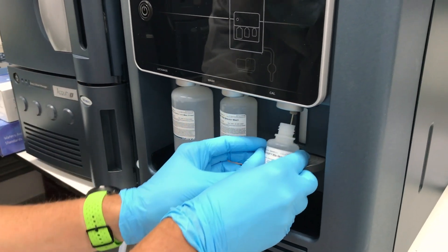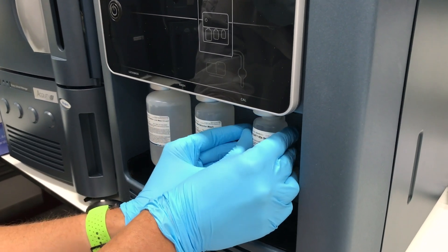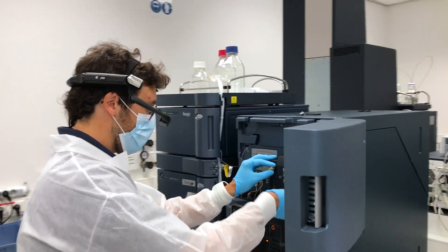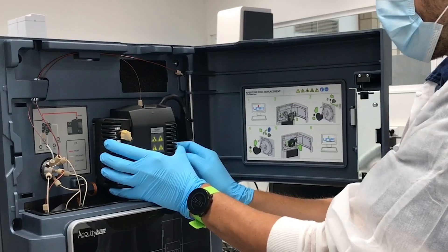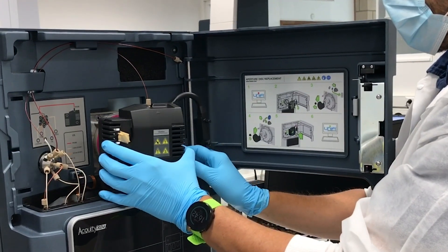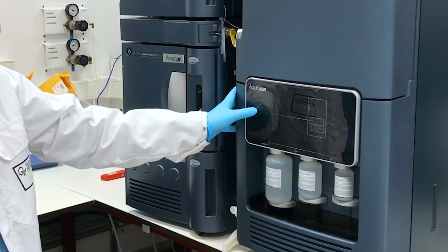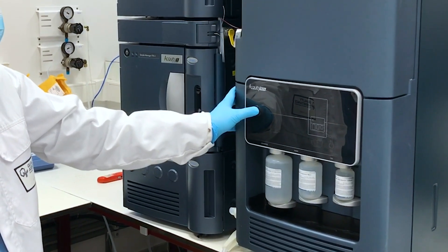It's really a gain of efficiency to have this system that can be installed very quickly. The BioAccord is very special because it's the first LC-MS system to be really considered as a single device from the beginning. It's very easy to implement — just one single button to start it up, and that's very easy and very fast.